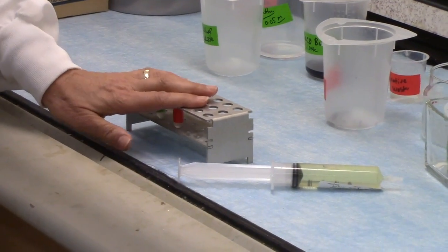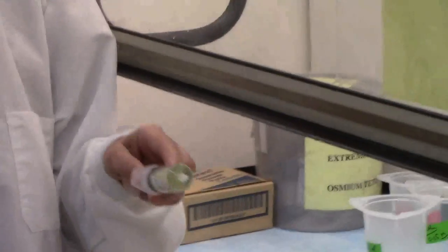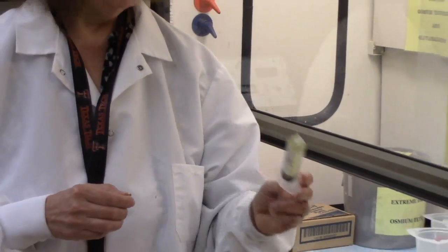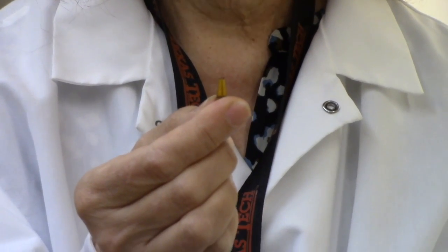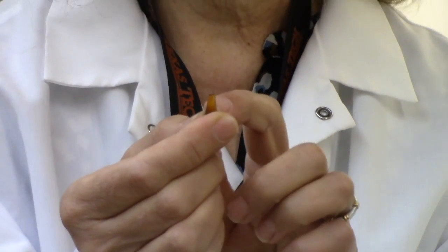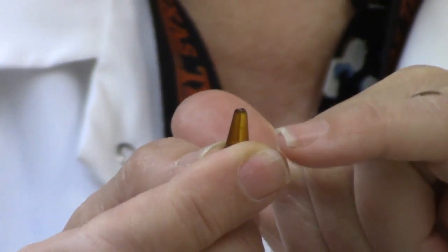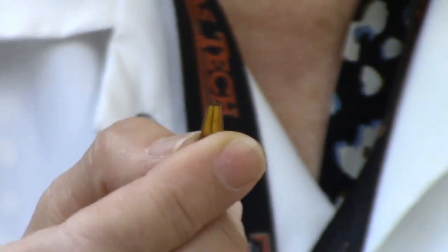To process the samples, we remove the liquid and replace it with alcohol, and then we replace the alcohol with a plastic resin that is liquid at room temperature but hardens when you put it in an oven. This is the sample once it's taken out of the oven after 48 hours — you'll notice that it's now a hard block and you can just barely see the sample at the very tip. Next we'll go to the cutting room and show you how we cut the sample.